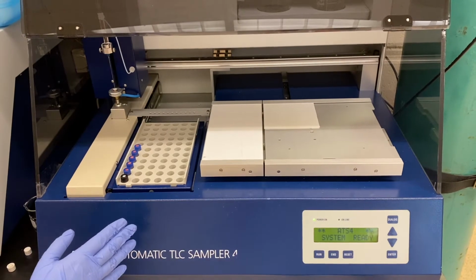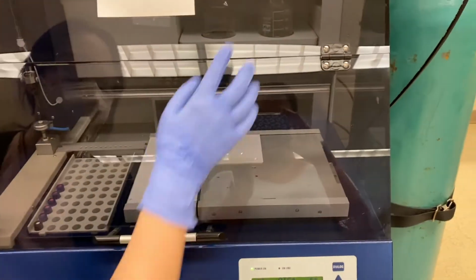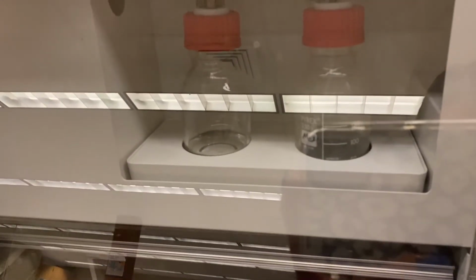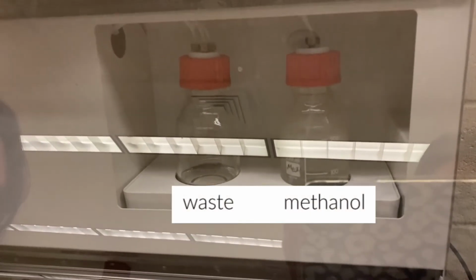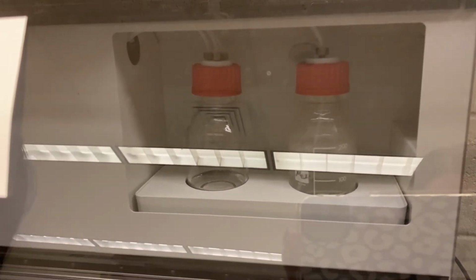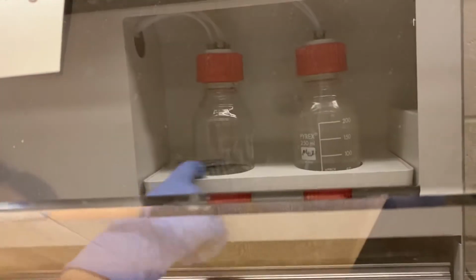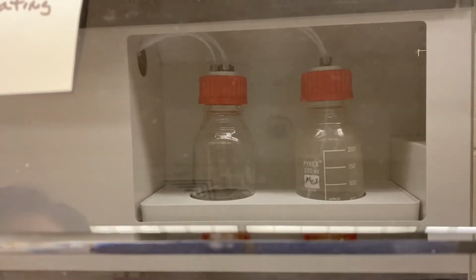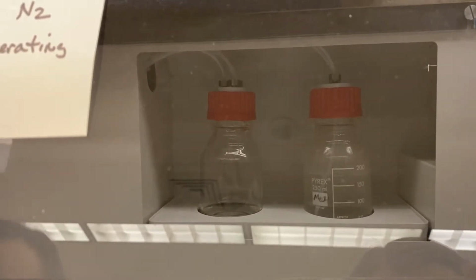But before every run, just make sure there are two big bottles in the back. Left side is a waste bottle, and on the right side is a methanol bottle. Just make sure methanol is full and waste is not. Make sure you cannot see any solution above this surface, this line. So right now we're good, and methanol still has around 200 milliliters, so we're good.